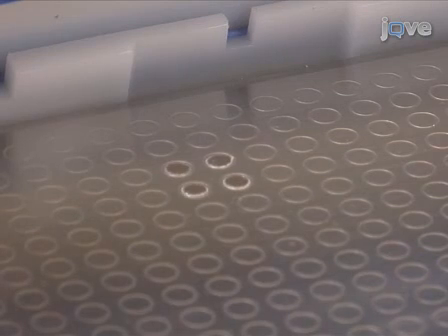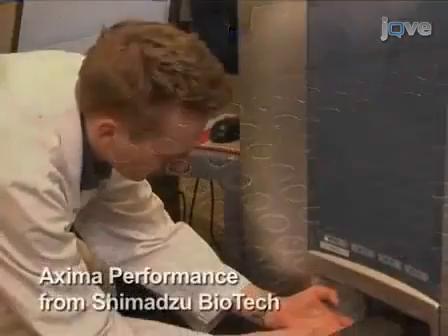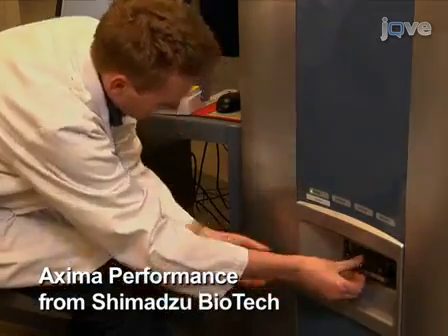It is important to maintain an appropriate length of time for mixing of the sample matrix liquid prior to crystallization, as described in detail in the accompanying written protocol. Once the sample has dried, place the target plate into a MALDI-TOF mass spectrometer.